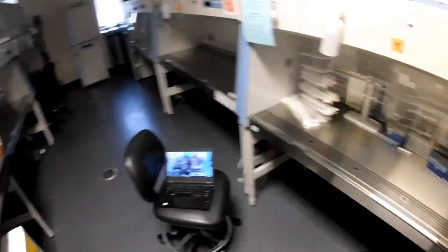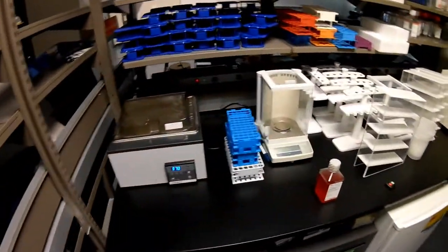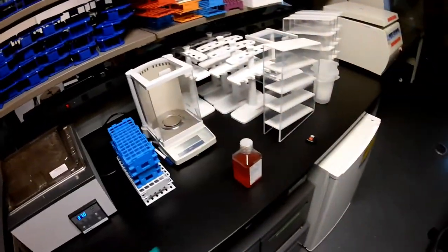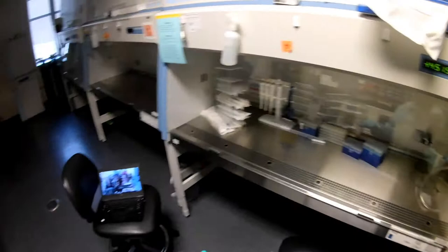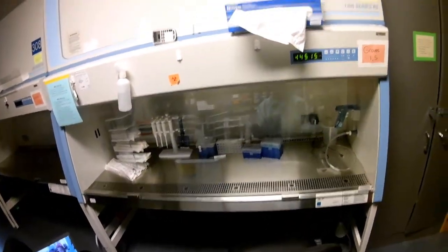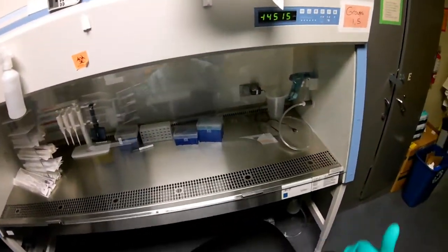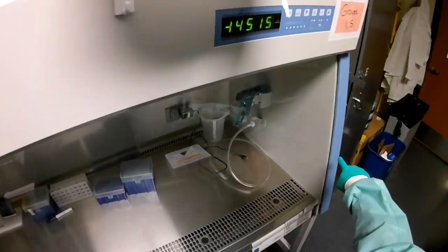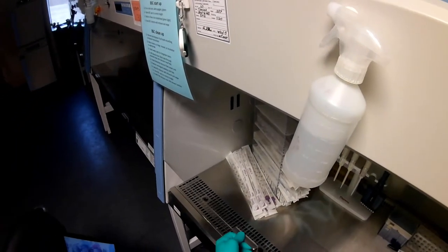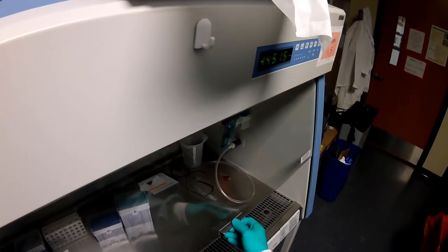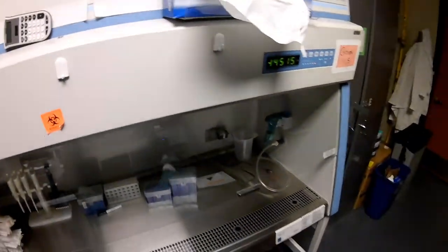So now I'm back in the junior lab room. And so we're going to get ready to do some cell culture. I need to warm up stuff in the water bath first, including my media. And I also need to get the biological safety cabinet ready. So the first thing I'm going to do is open up the biological safety cabinet. We want to open up to the marks on either side that shows us how high it's supposed to be. It will stop beeping once we get it there.